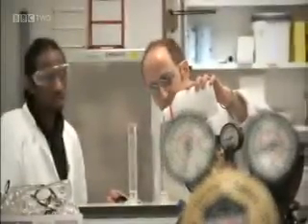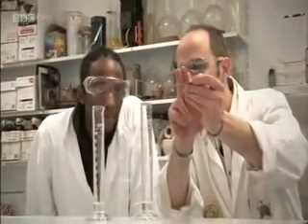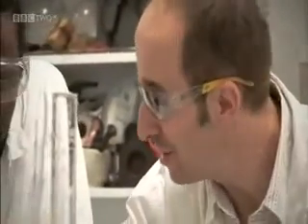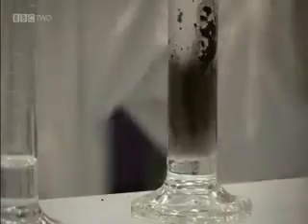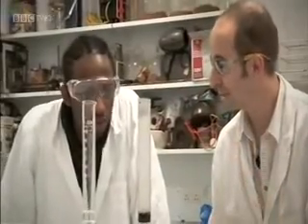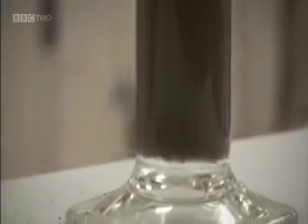Back to Professor Seller and his great experiments. Here we have hydrogen peroxide, and I'm going to add a little bit of a solid catalyst — this is manganese dioxide. Can you see that the tiny little flecks of manganese dioxide are actually causing the reaction? They're causing hydrogen peroxide to decompose into oxygen and water, and they're reacting while remaining unchanged. Now on this side, we've got the same hydrogen peroxide but without the catalyst, and it decomposes very, very slowly. Let's give it a real load of catalyst to see what happens.